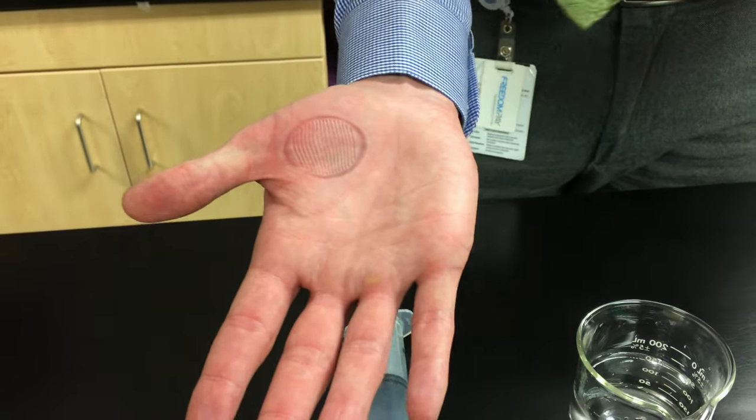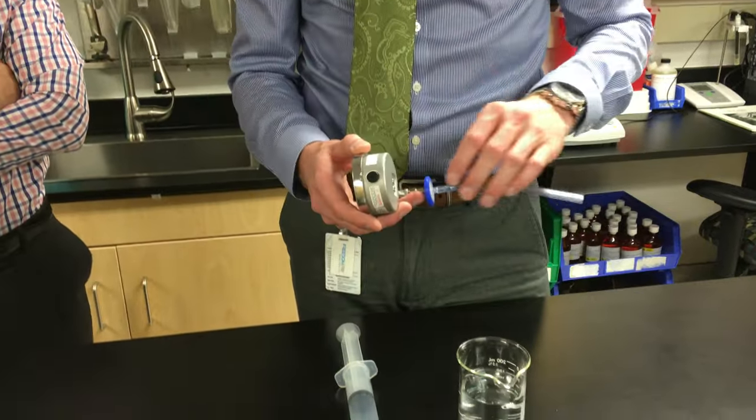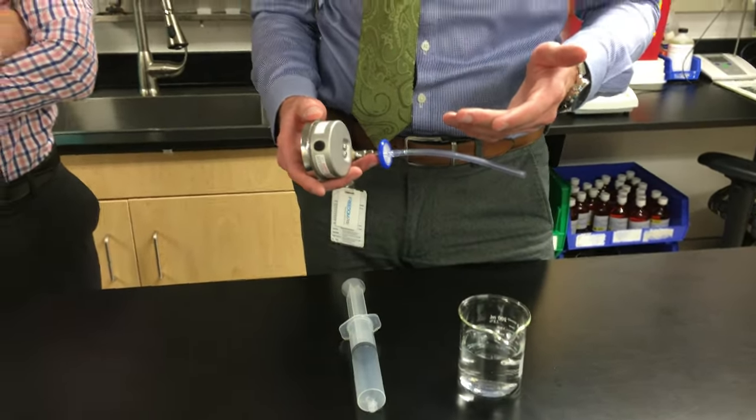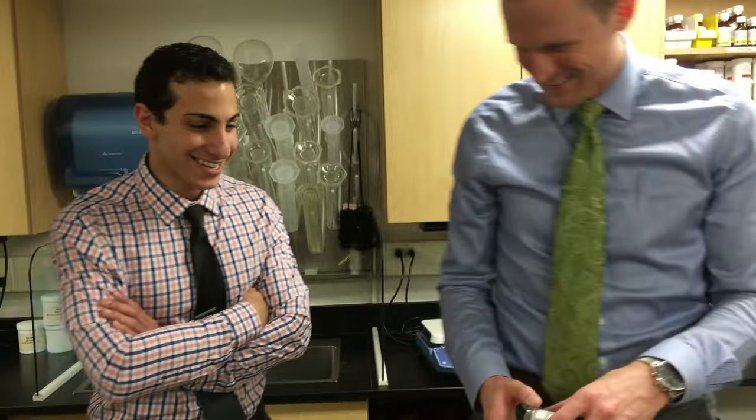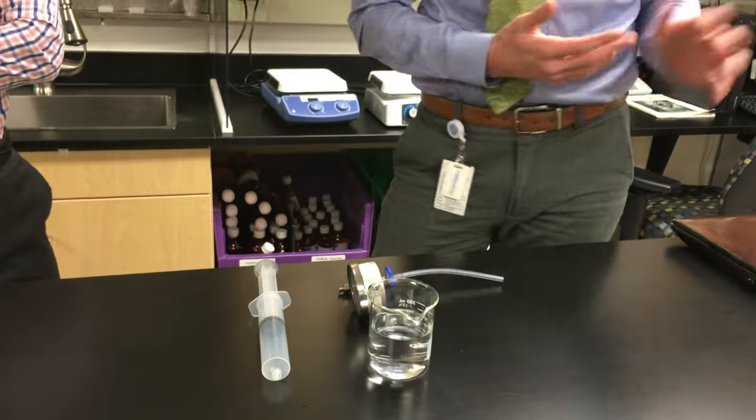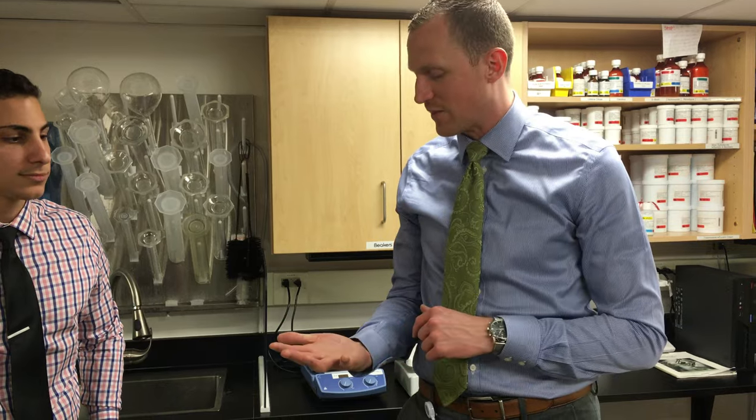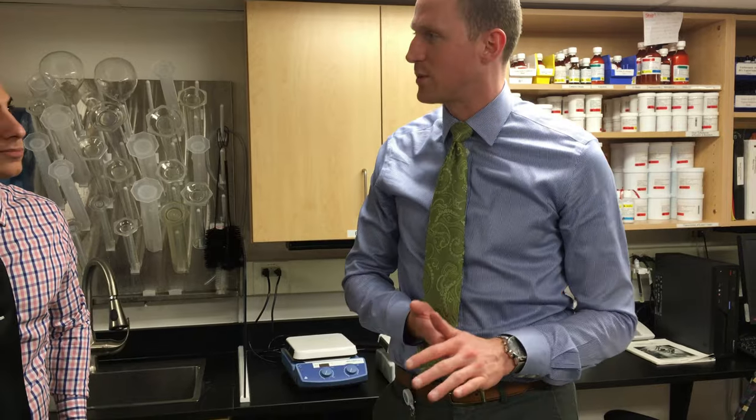There's quite a mark on my hand which will be there for a while. It does require a lot of force. Do you want to see how hard it is? It's very difficult. We tested on three random pharmacists based on availability and two out of three failed - they couldn't get up to the appropriate pressure. One of them did it, but it was the same situation: painful hand at the end and struggling to get it. But that's the manual method for doing a bubble point test.